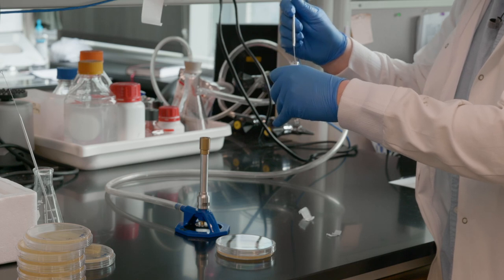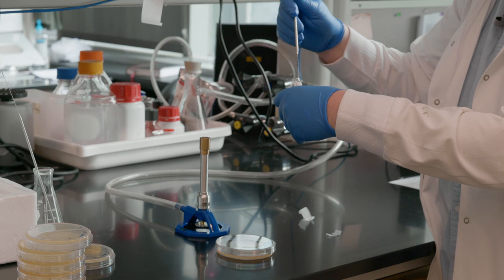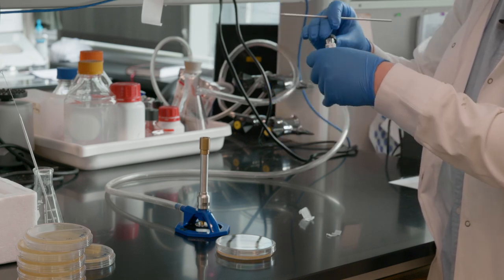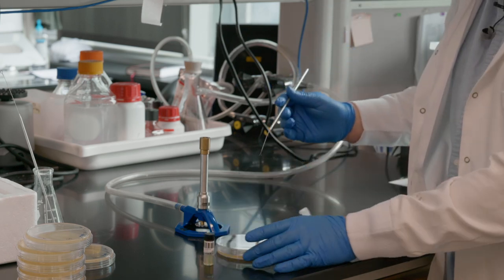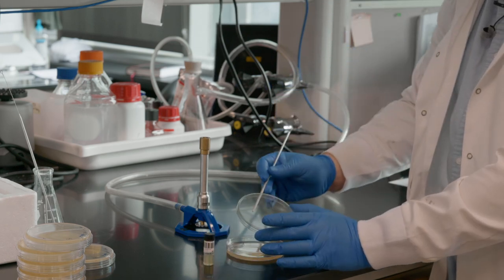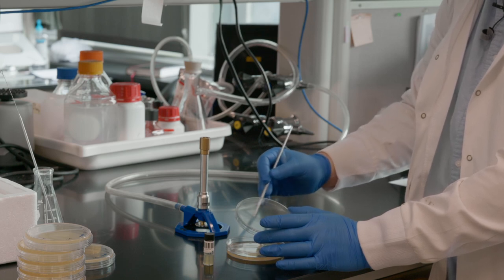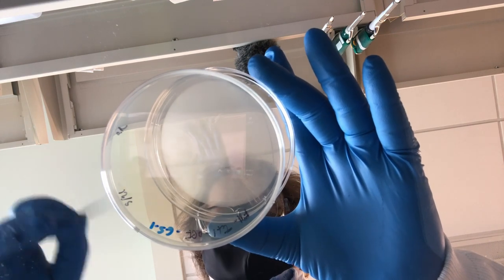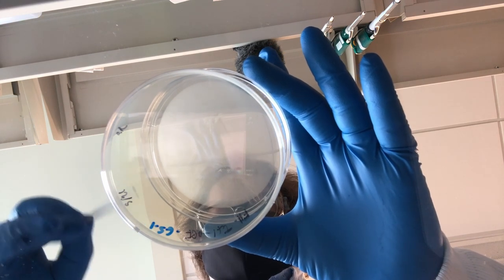And this is just going to be scraped along the surface here. Now this gets scraped along gently. The important thing here is you want to try to not dig too hard into the agar.